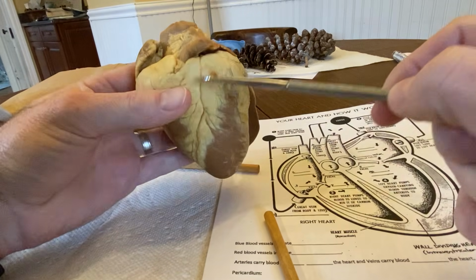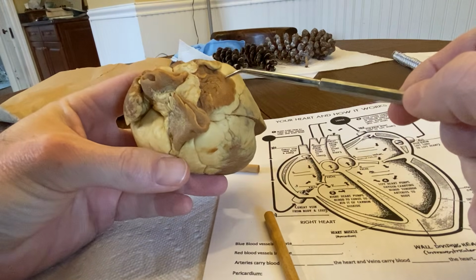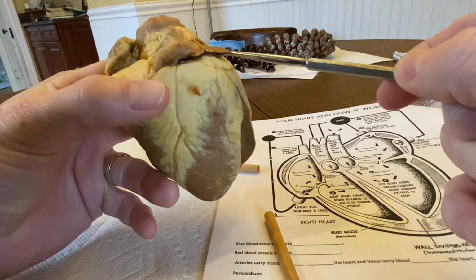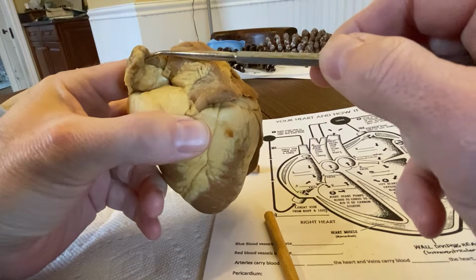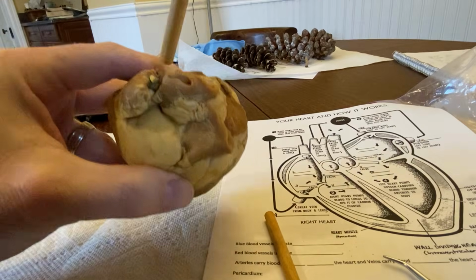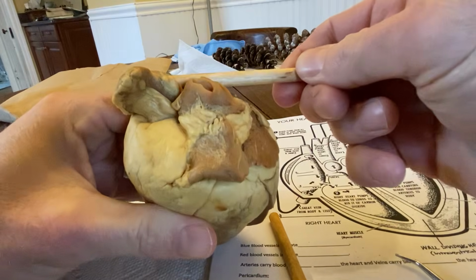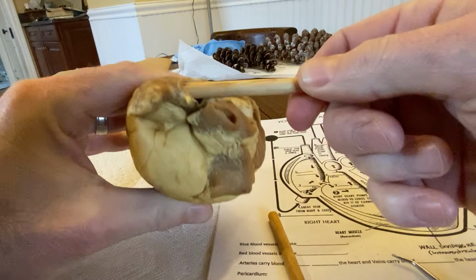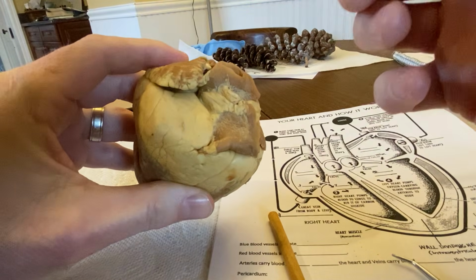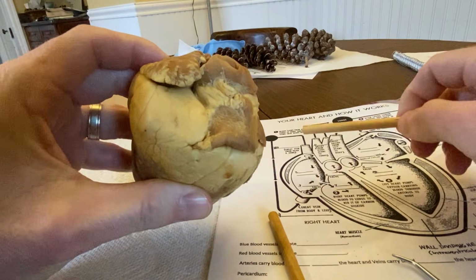And then on the top, the part that is most striking to people are the atria. So the atria are not like big chambers. This is actually one of the atria right here. It's like this flat little balloon, kind of hard to see there. On this side, this one's a little bit more distended, but this is the atria, okay? So when blood flows into them, what you'd actually see is something that looks a little bit more like this, okay? Where it will expand out. I'm expanding this out with a wooden rod, okay? And then when the atria contract, they squeeze the blood down and in, so that flattens out, and then it would fill and flatten out. It's almost like a balloon inflating and then deflating over and over on the outside of the heart, okay?